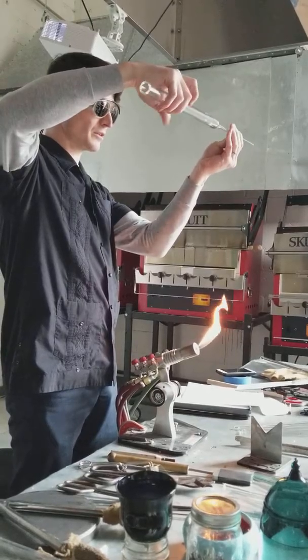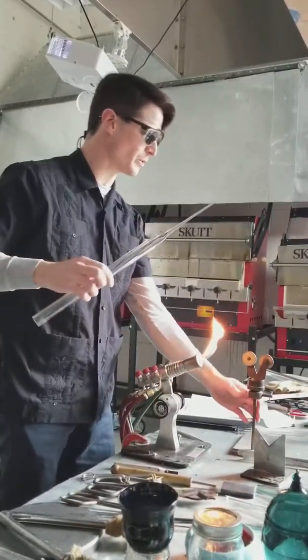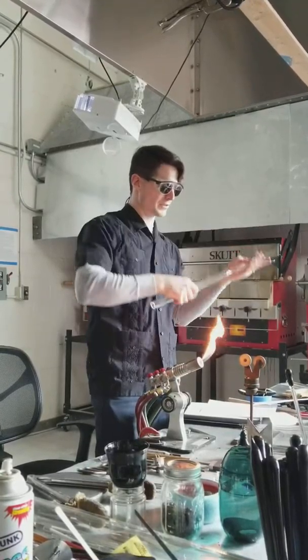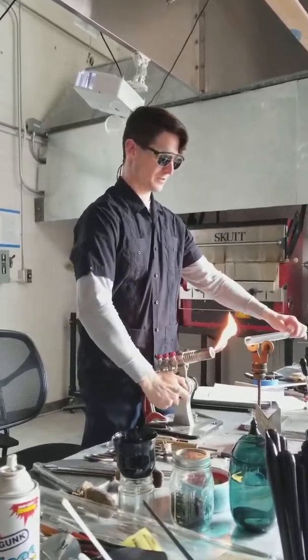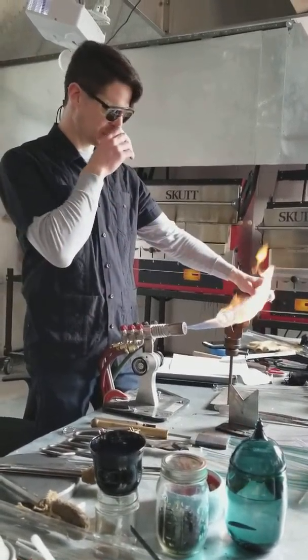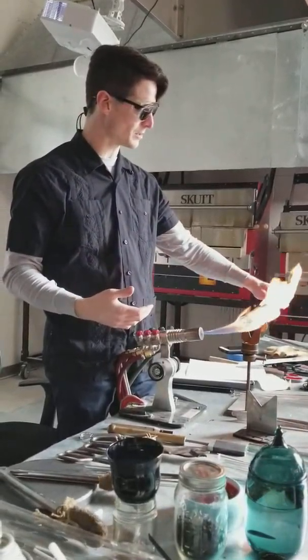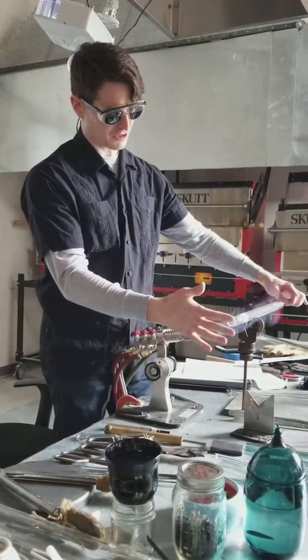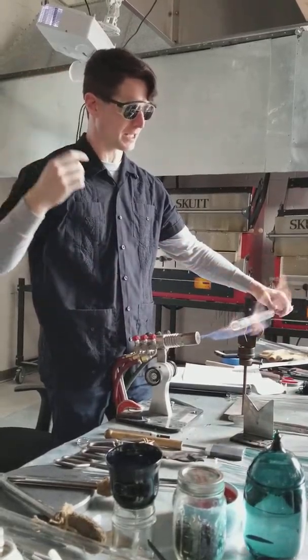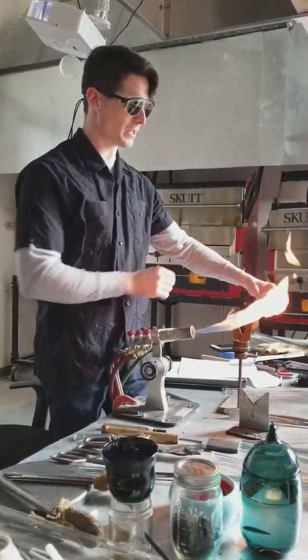I'm not quite sure how it did — it looks alright, we'll find out. What happens is errors can accentuate: if you get off at one point then the next pull will be off subsequently even a little bit more, because it's referencing where you're turning from, which is off. Everything kind of follows that sequence. Now I'm adjusting my flame height. I'm only using my center flame on this because that's what you guys will be using. I'm pre-warming here — this is a little bit more important even than before, where I was using the flame annealing flame to warm up my tube.